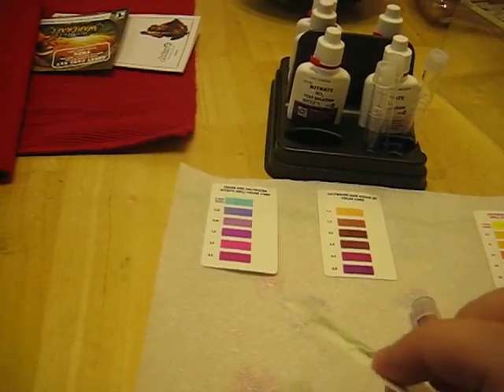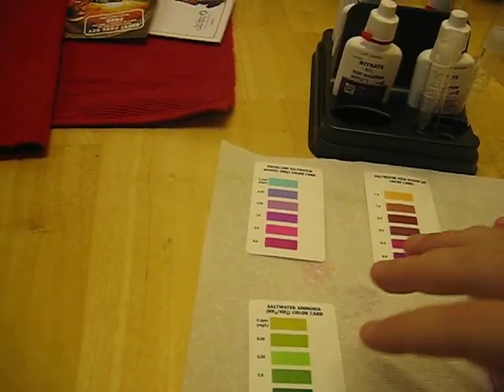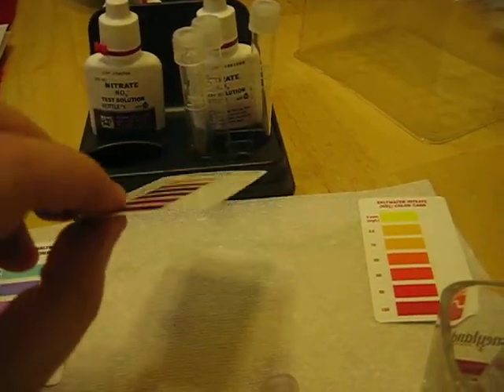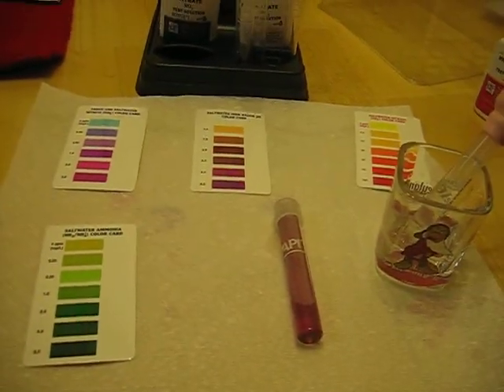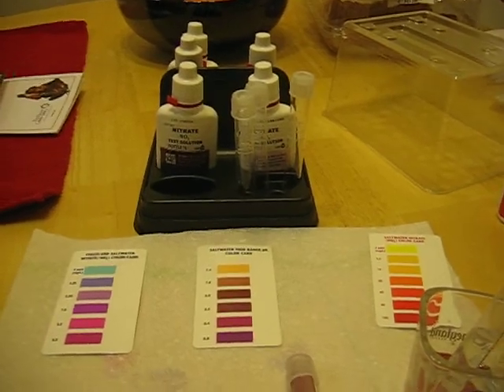Actually, you do have to wait for the ammonia too. So if I had to recommend, I'd say nitrate first, followed by nitrite or ammonia, and then finally high-range pH, which is pretty much an instant test. I'm going to throw this up on YouTube now — just wanted to let you all see what kind of test kit I use.